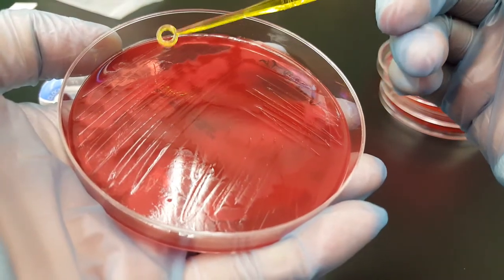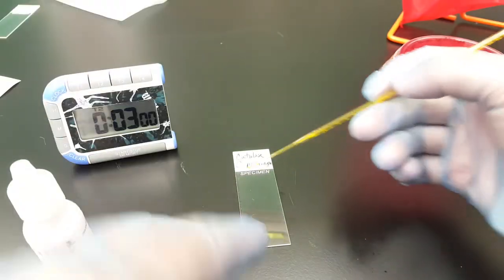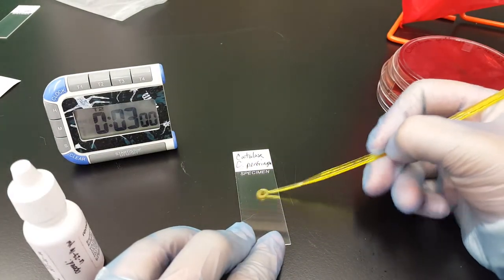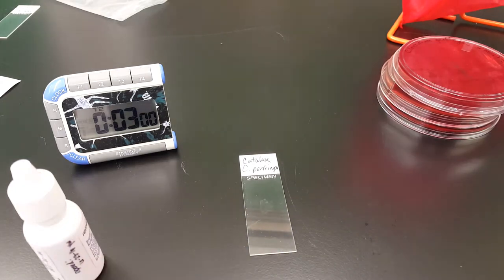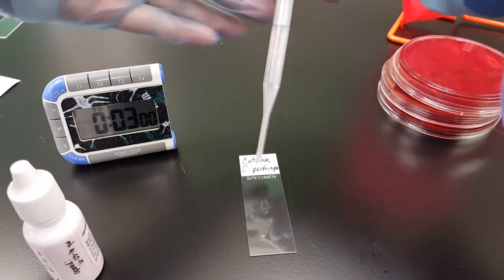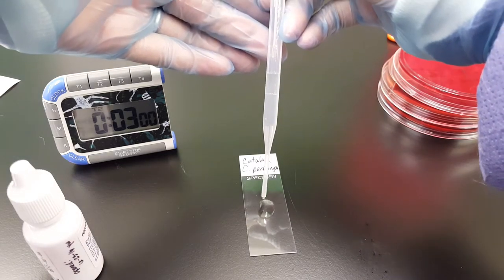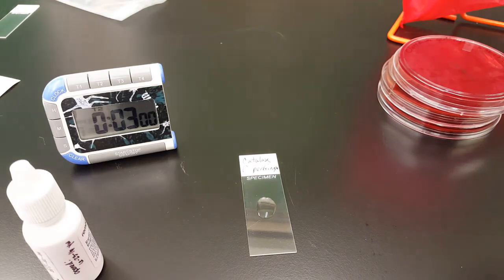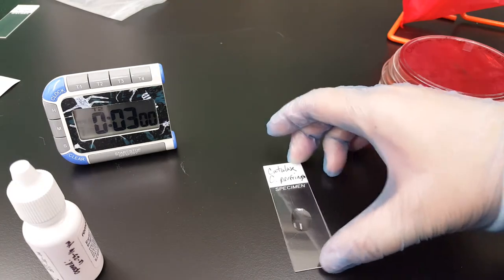Sorry, you can't see that on film. And spread it on the slide. Then we've got this from my lovely assistant over there. This is the hydrogen peroxide, also known as H2O2.